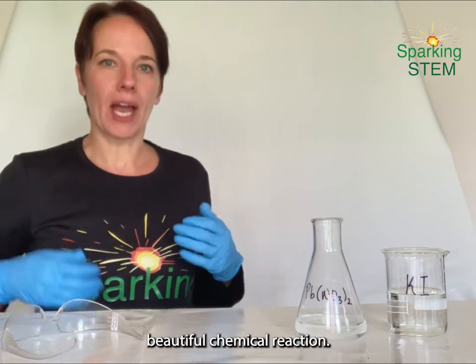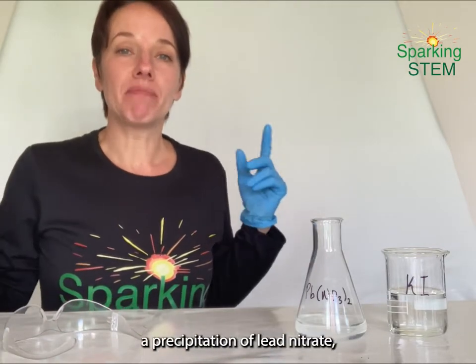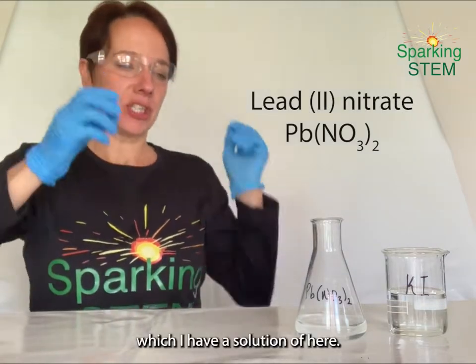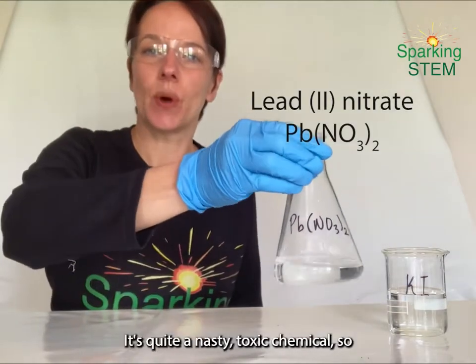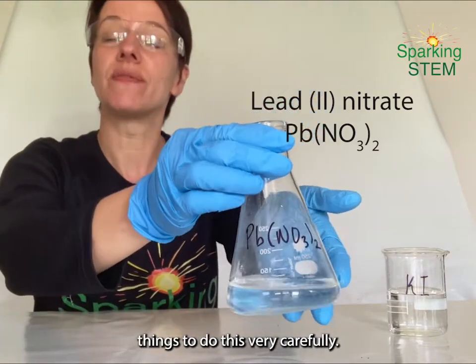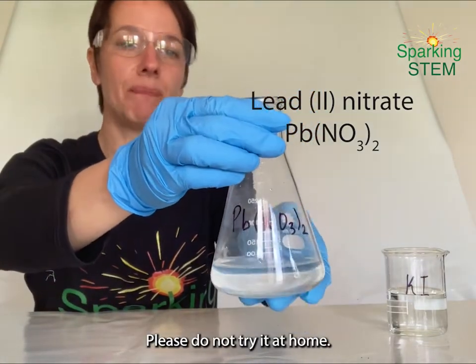This session has got the most sparkly, beautiful chemical reaction. We're going to do a precipitate of lead nitrate, which I have a solution of here. It's quite a nasty toxic chemical, so I've done lots of health and safety things to do this very carefully. Please do not try it at home.